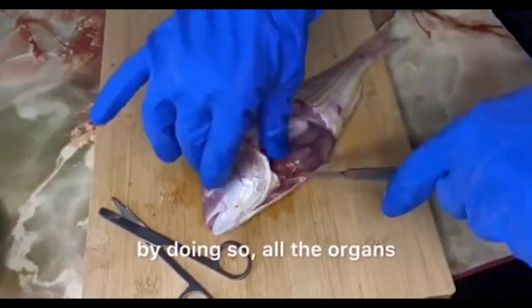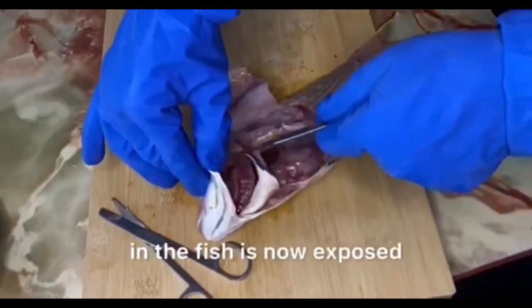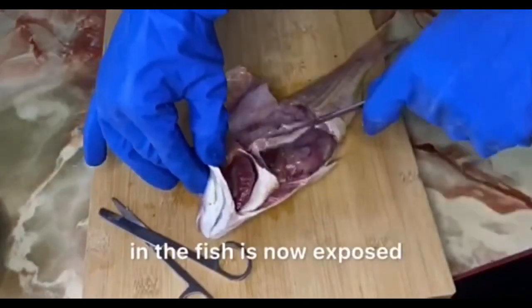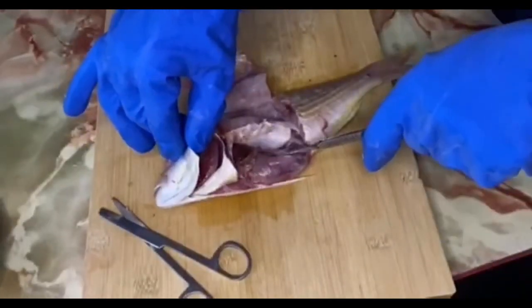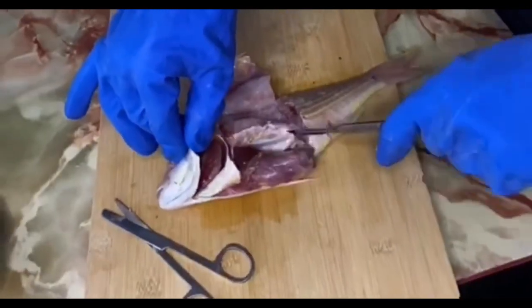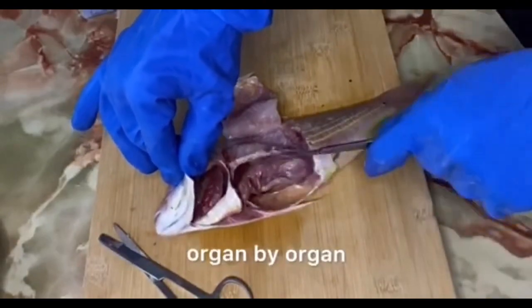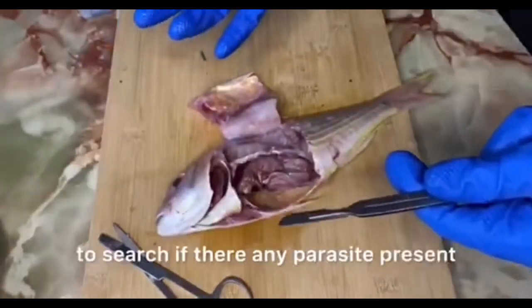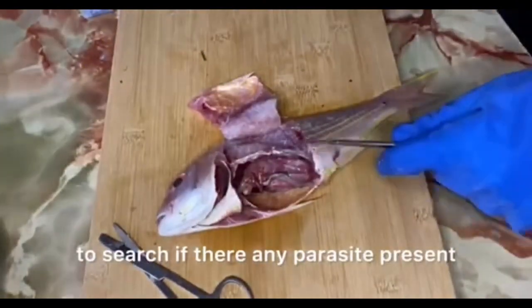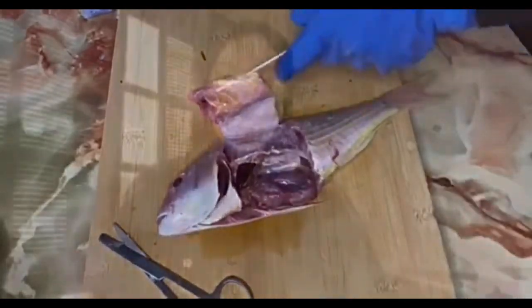By doing so, all the organs in the fish are now exposed. Then I will proceed organ by organ to search if there are any parasites present. Thank you very much for watching.